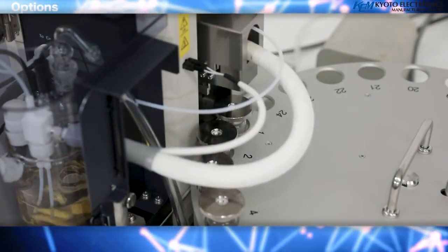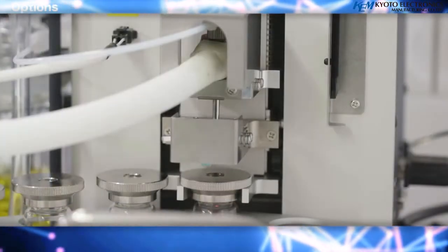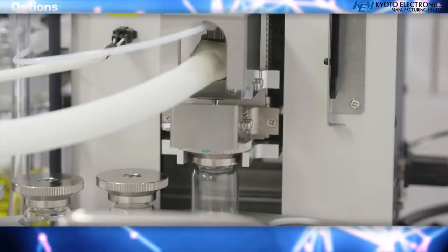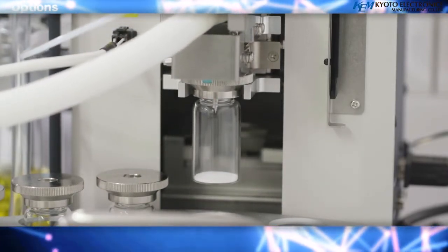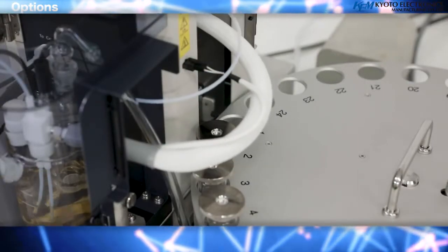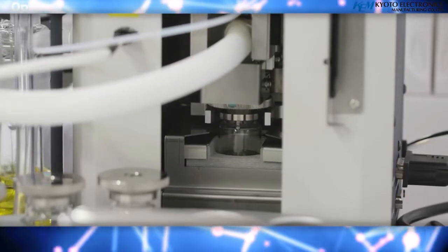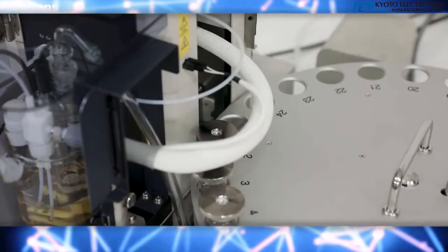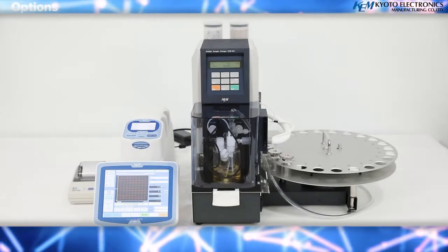The multiple sample evaporator for the Coulometric Karl Fischer moisture titrator is suitable for the continuous measurement of up to 24 samples. The heating temperature can be set for each sample individually, therefore different types of samples can be measured automatically one after the other. An auto power-off function after measurement ensures safe operation.